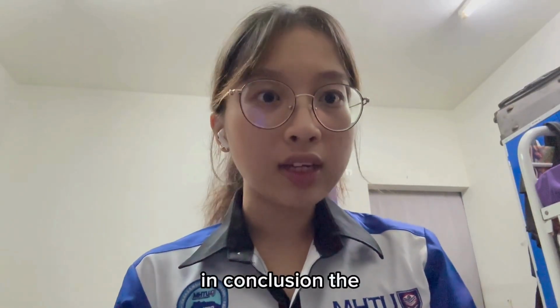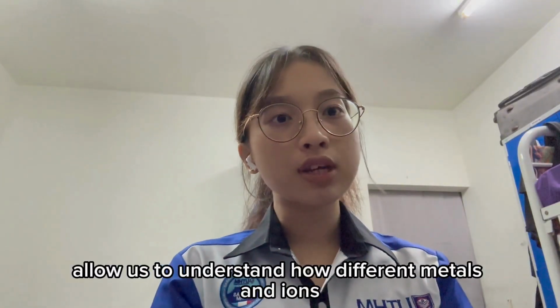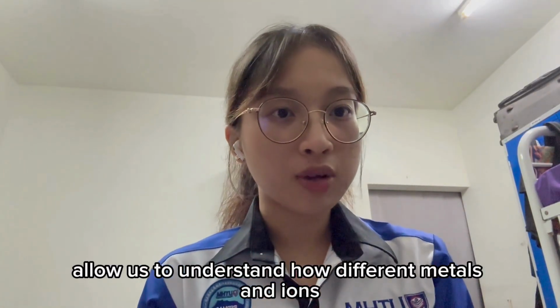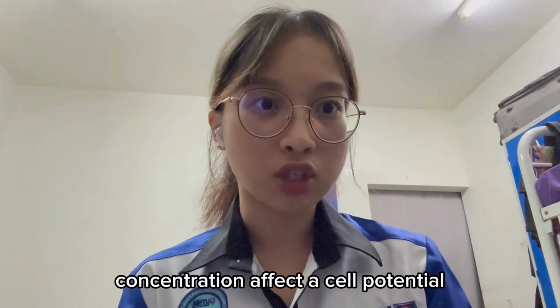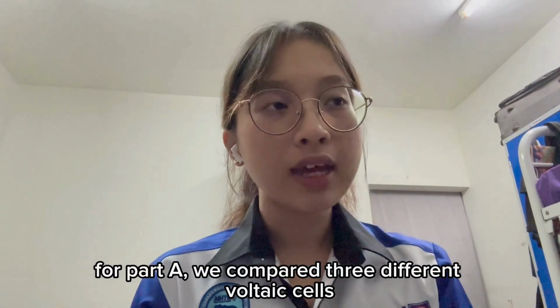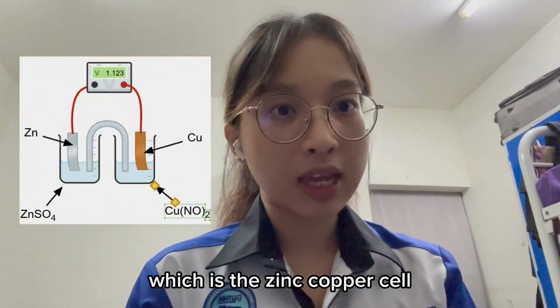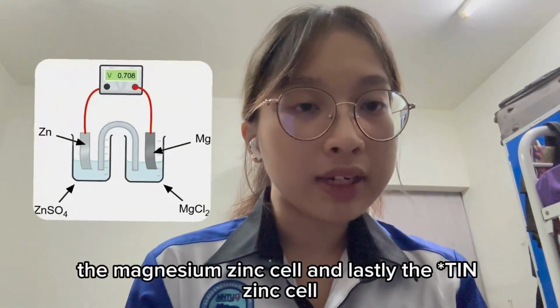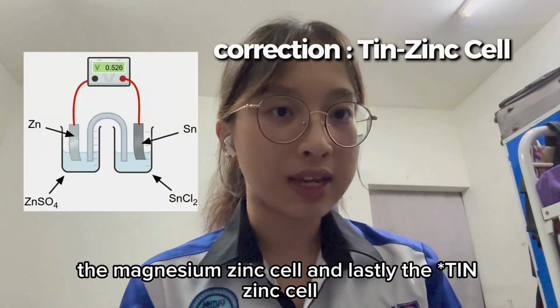In conclusion, this electrochemistry experiment allows us to understand how different metals and ion concentrations affect a cell potential. For part A, we compared 3 different voltaic cells, which are the zinc-copper cell, the magnesium-zinc cell, and lastly the tin-zinc cell.